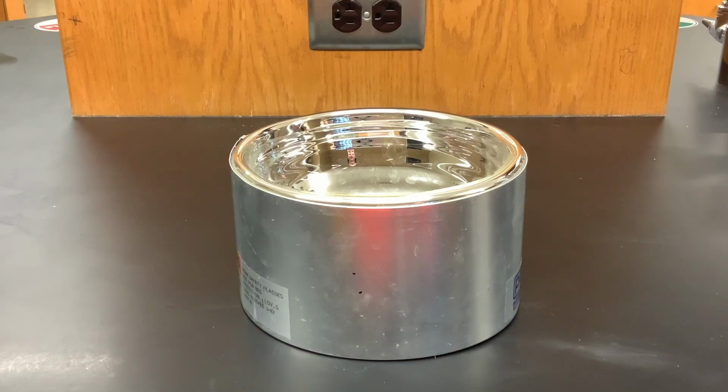For this experiment, we're going to be looking at the effects of liquid nitrogen on the volume of a gas. So we're going to be cooling our gas down to a temperature of almost negative 200 degrees Celsius. Liquid nitrogen is very cold. It's very dangerous for your skin. So I'm going to be wearing protective safety glasses and safety gloves.